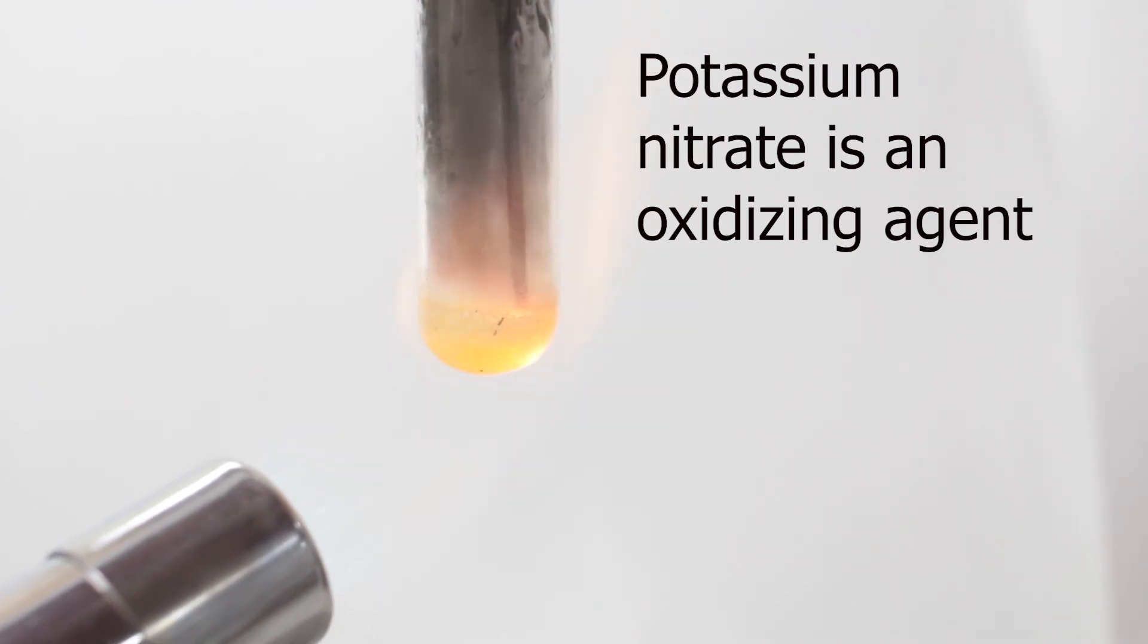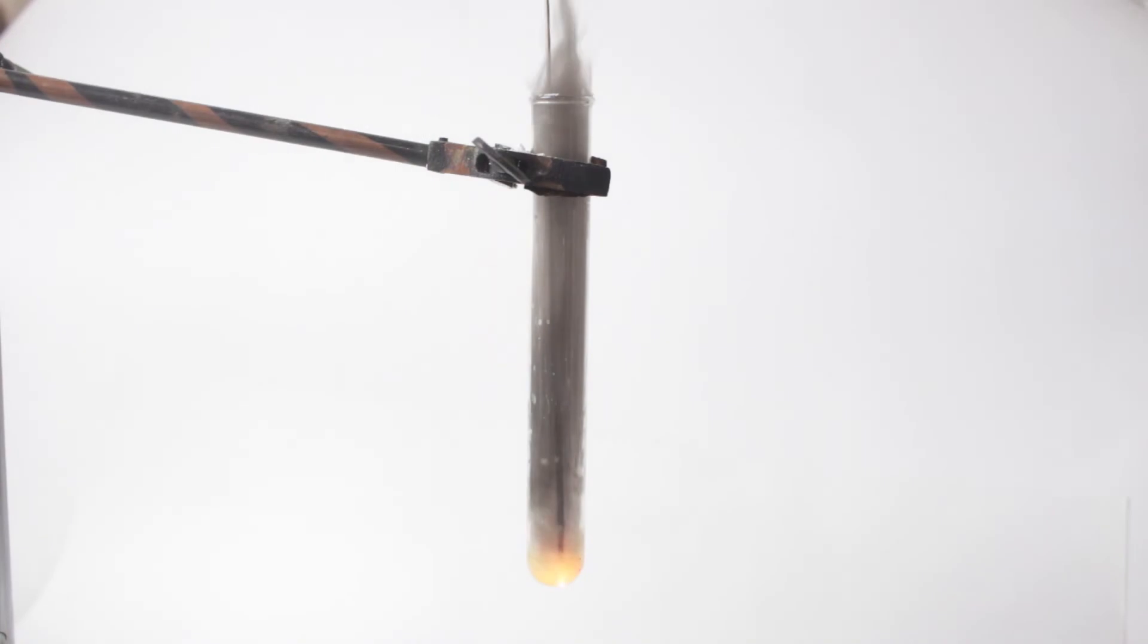I don't really have to heat it up. The reaction generates enough heat to keep the salt molten. You see, the splint lowers itself into the salt by the force of gravity and is being eaten up from the head.